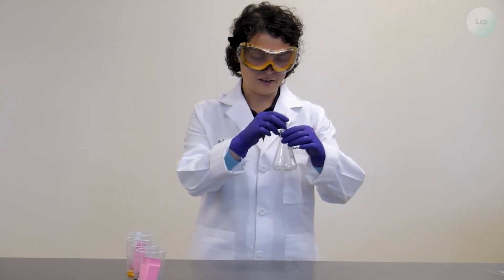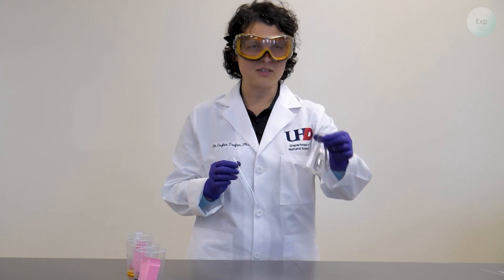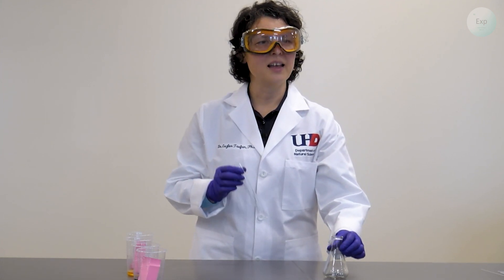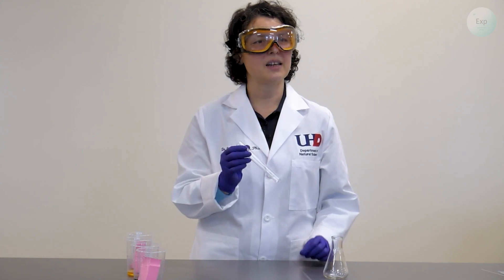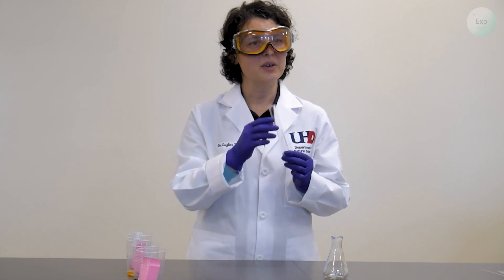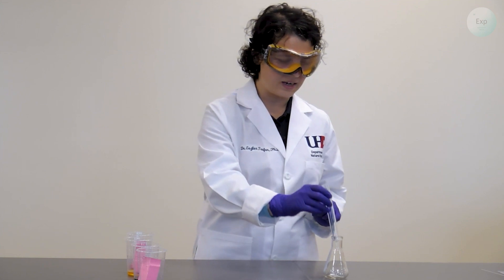We also need an Erlenmeyer flask and I like to use this one because it keeps it steady and it's rather transparent so I know exactly what is happening inside the test tube, which I also need because I will be layering the solutions in it.